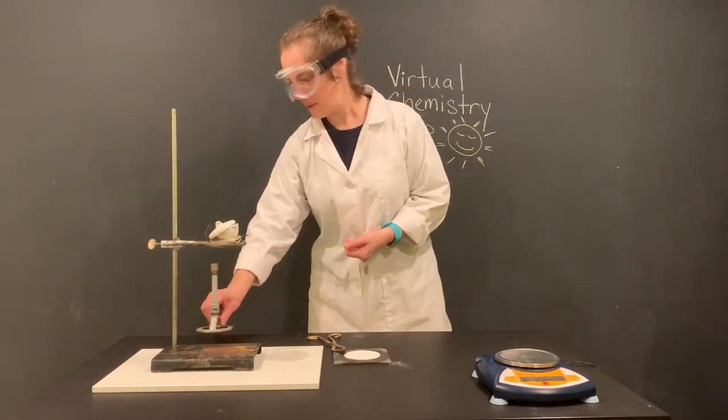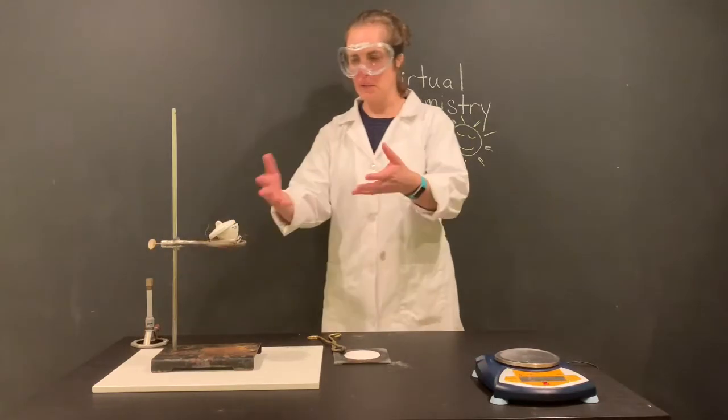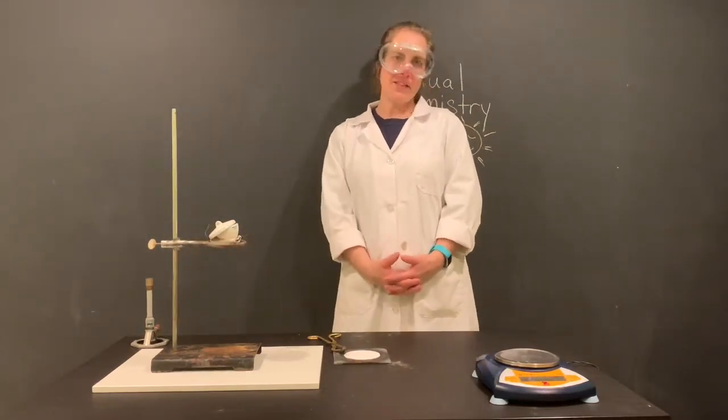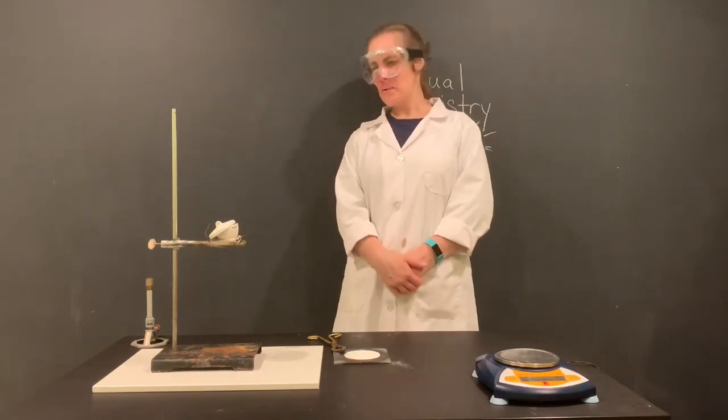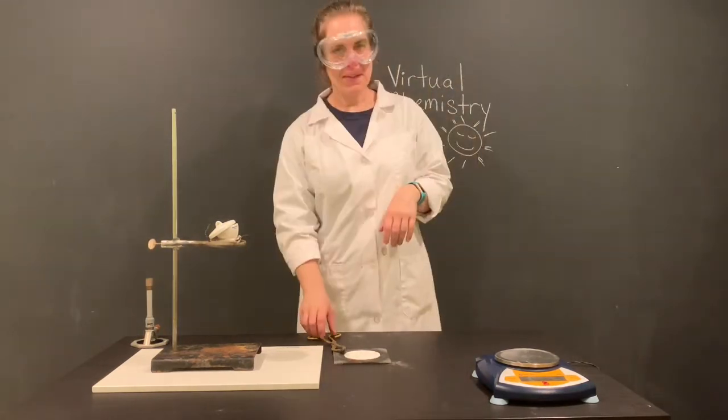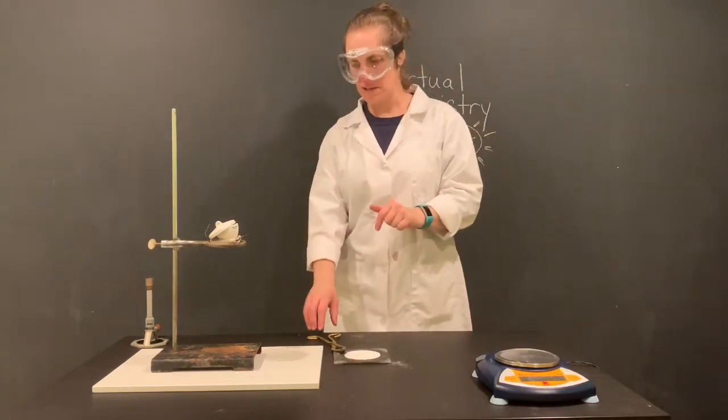I'm going to move this out of the way again, and once again, now we're going to wait for this to cool. How long will it take to cool? Probably another five minutes because it got just as hot, just not for as long. So we're waiting, we're waiting, we're waiting. So now we'll assume now it's about, it's cool enough.